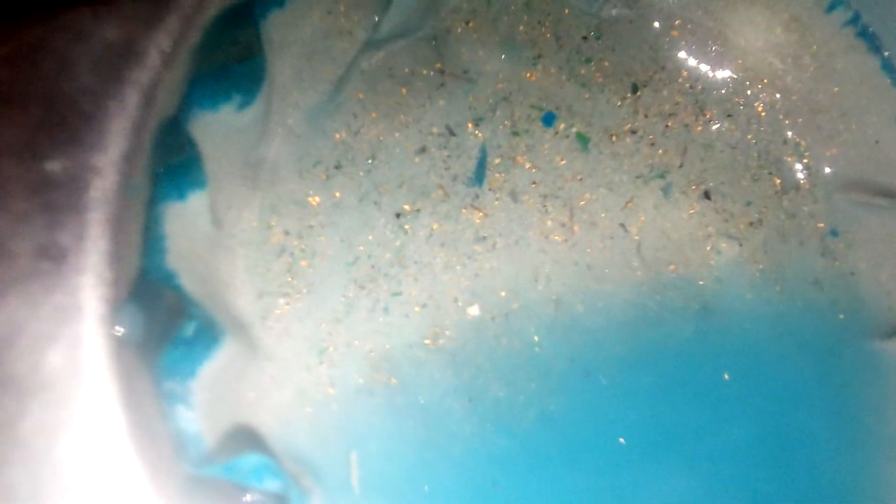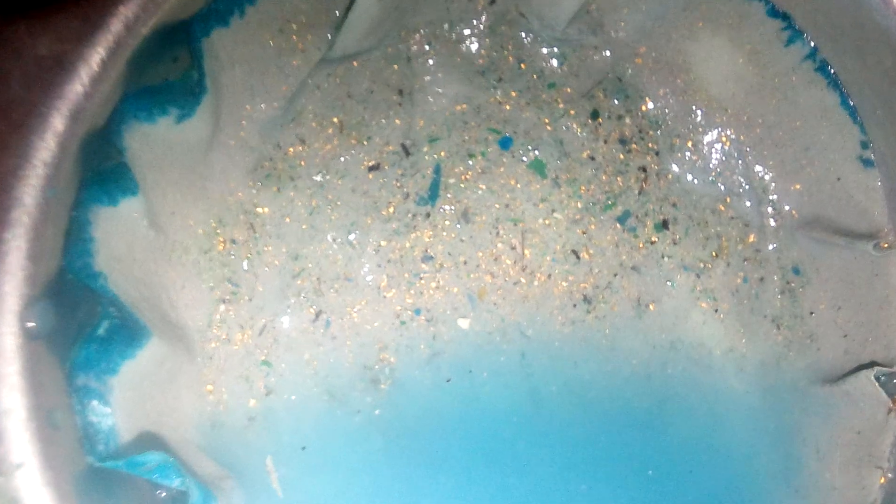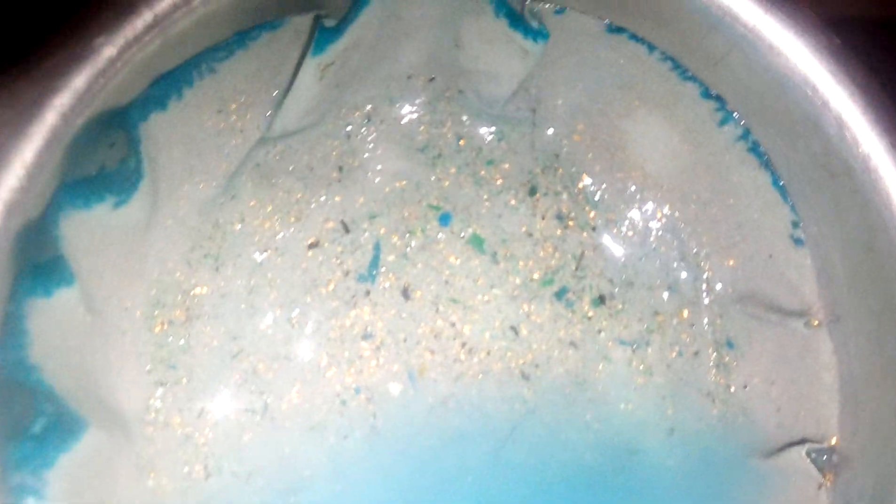You can see it's all microscopic but it's very shiny and there's quite a bit in there. It's all following the flow of the liquid. It's quite shiny. It still needs to be dried out and removed from the coffee filter. There is an amount of gunge in there which is actually probably the glue from the circuit boards themselves. It's a very shiny amount gathered up in the corner, as you can see — quite nice.